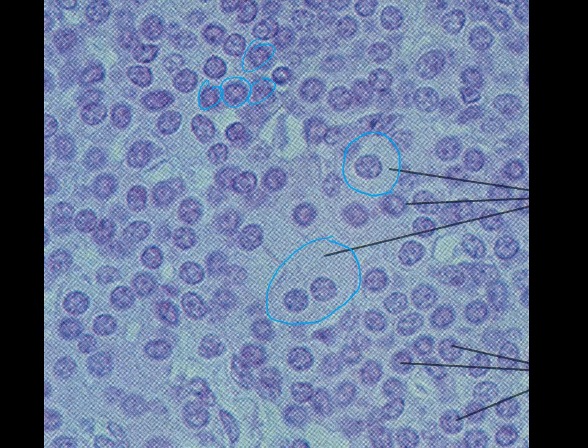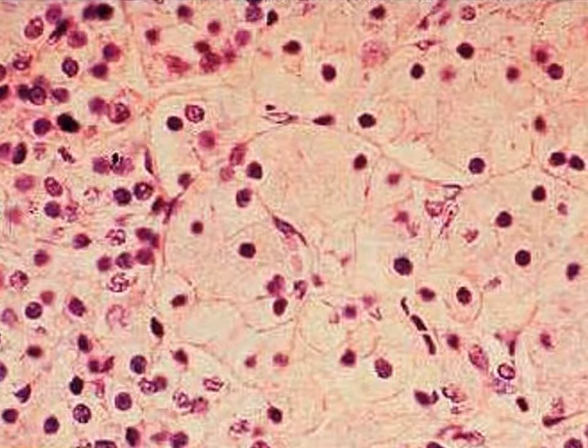Kind of the oxyphil cells, not really a well-known function for those cells, versus the chief cells are the ones that are producing the hormone for us in terms of parathyroid. Once again, just a different picture showing us kind of the differences that we can see there. These larger cells are those oxyphil cells, and then over on the side here we have all of our chief cells inside that parathyroid gland.